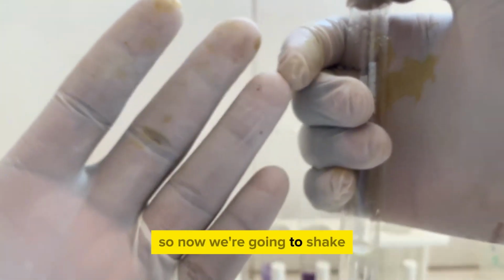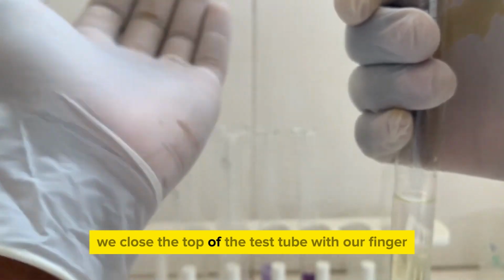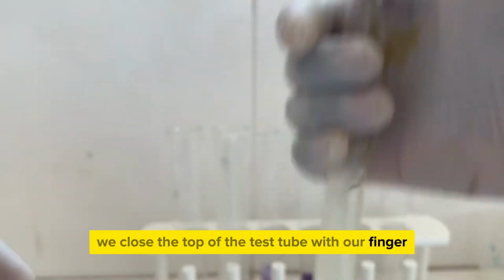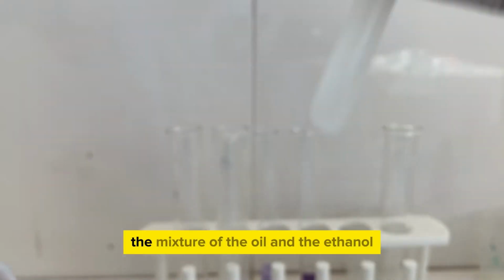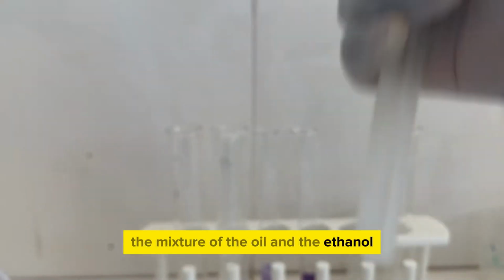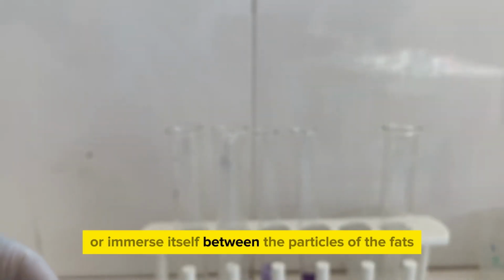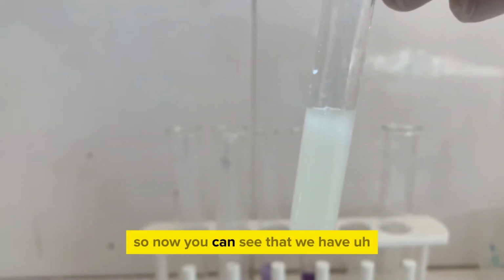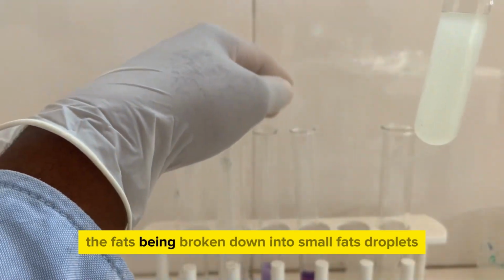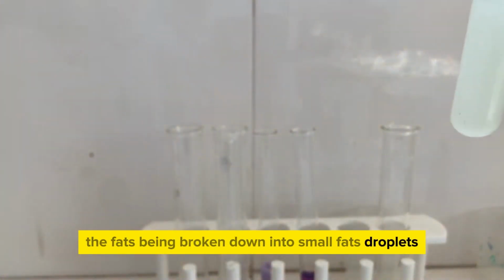So now we're going to shake. We close the top of the test tube with our finger. Remember to wear gloves so that no chemicals get onto your skin. So gloves for safety. Shake vigorously the mixture of the oil and the ethanol. This is so that the ethanol can break down the fats or immerse itself between the particles of the fats. So now you can see that we have the fats being broken down into small fat droplets.